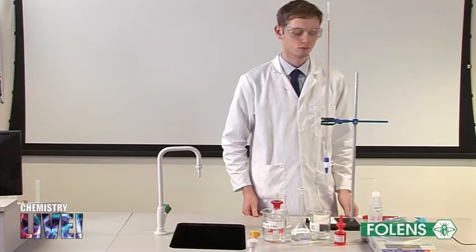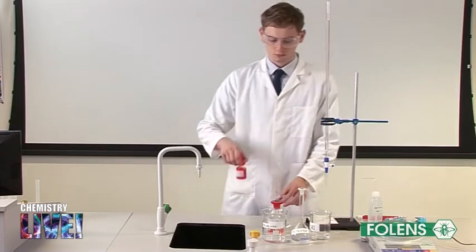Three drops of methyl orange indicator are added to the sodium carbonate in the conical flask.